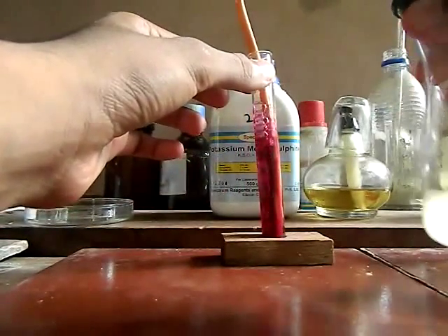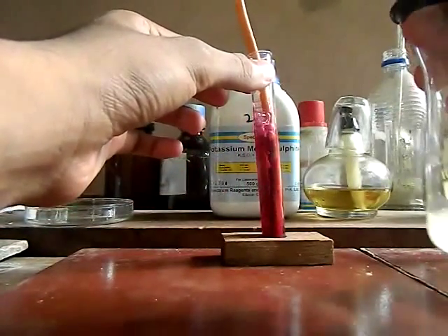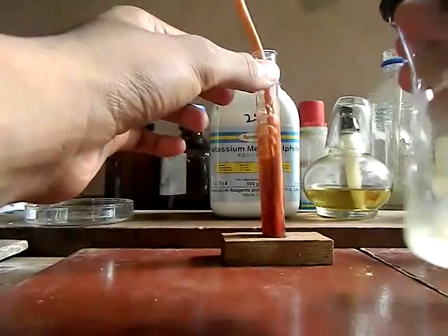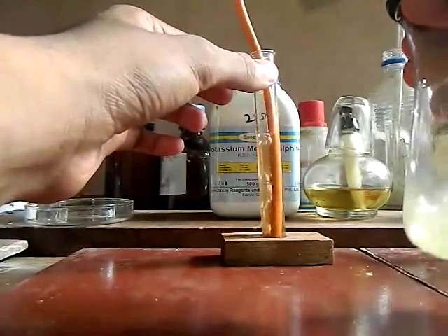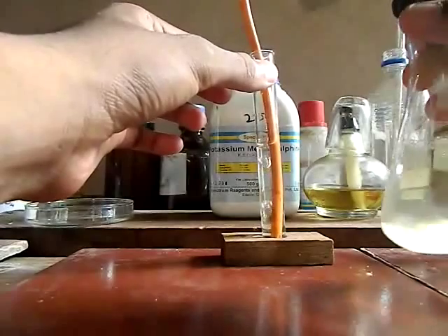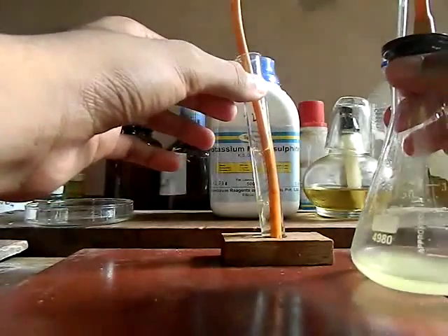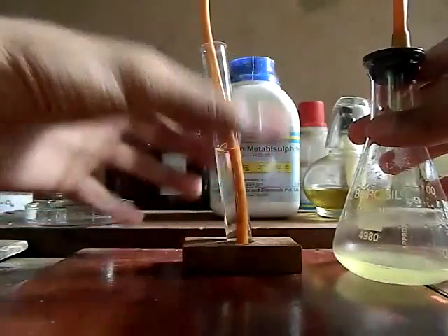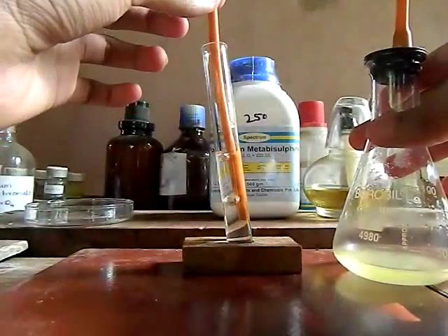Watch carefully. It takes some time because the potassium permanganate solution I have prepared is a little concentrated. Here you go — it has been decolorized.